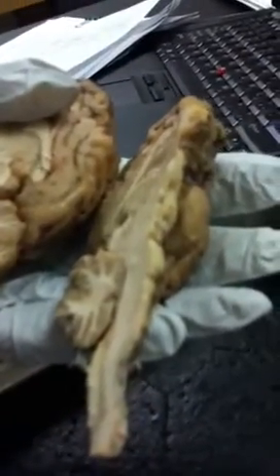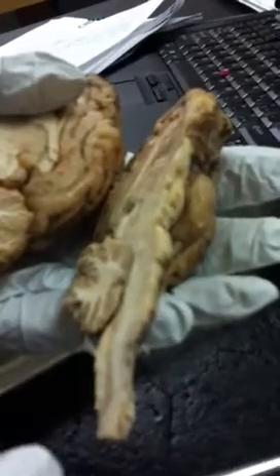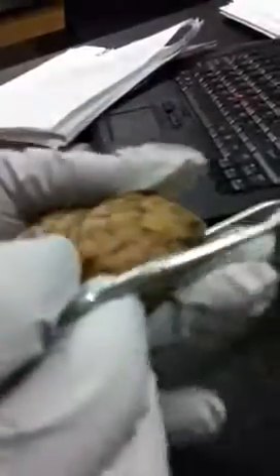Let's see what else. Superior and inferior colliculi. We already did that. We discussed everything. Yeah. We have everything.